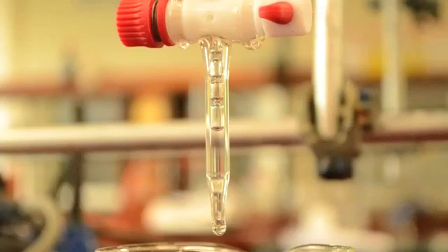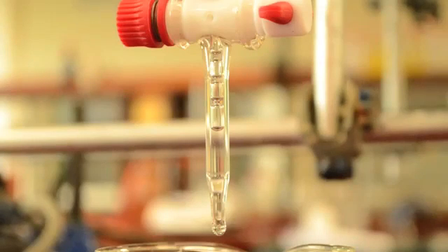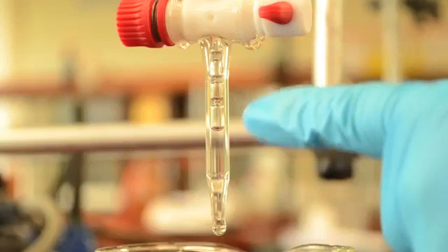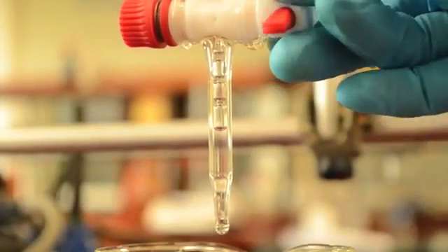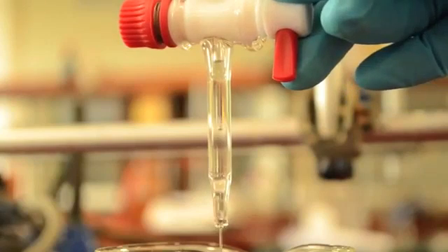Open the tap slowly and allow some of the acid solution to run through into a waste beaker, filling the tap and the space below the tap. Ensure any bubbles or airlocks are removed.